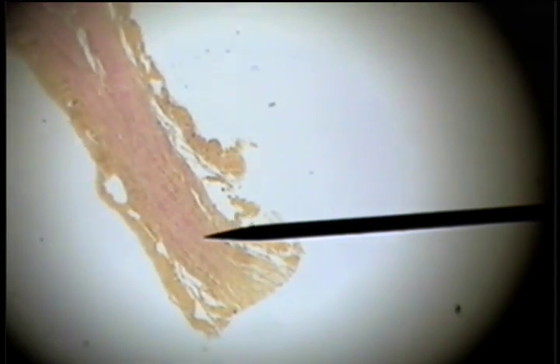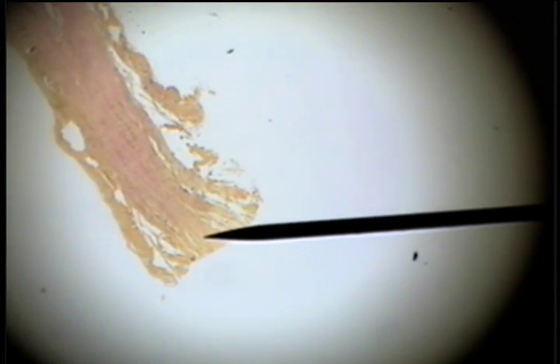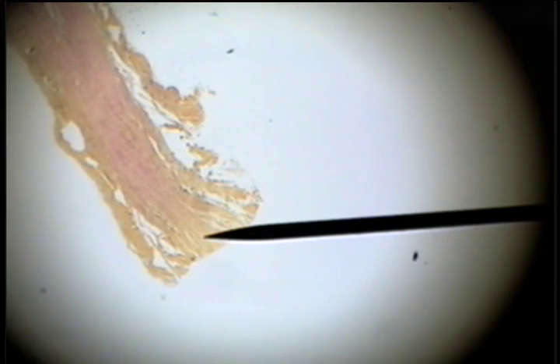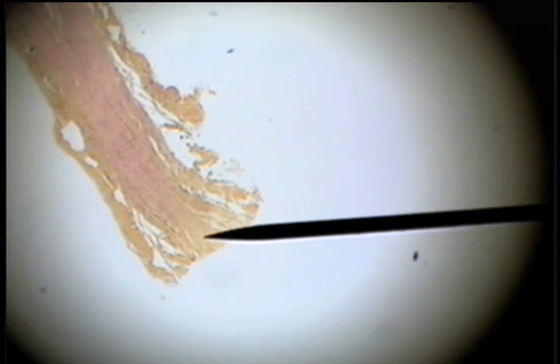And this is dense regular collagenous connective tissue. This would be the end that would be attached to the bone, and you can see that it is feathered out down here.